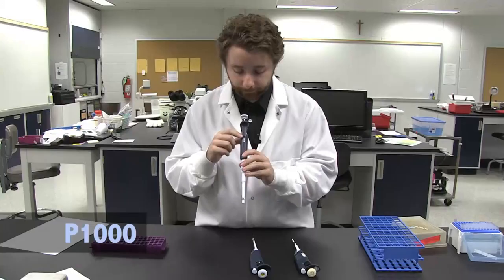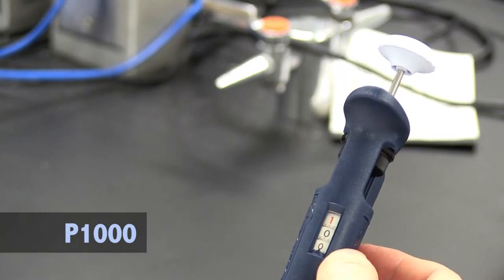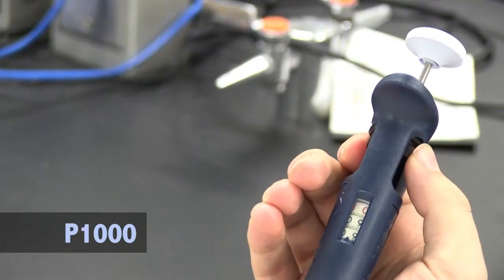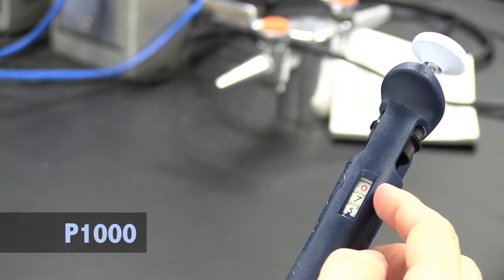For a P1000 micropipetter, we look at the number on the volume indicator — 100 — and we multiply that number by 10. So this micropipetter is set to 1000 µL, which is 100 times 10. If I want to set it to 750 µL, I'll turn the volume adjustment knob until it reads 075. The volume indicator reads 075, so multiplying that by 10 tells me that this micropipetter is now set to 750 µL.